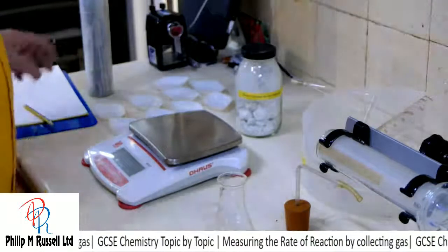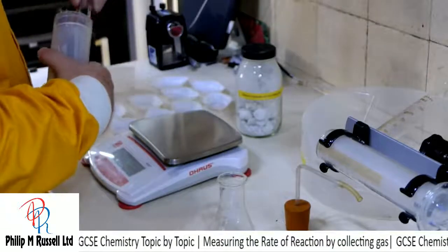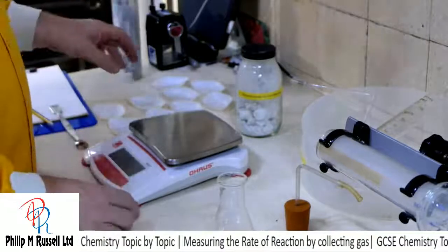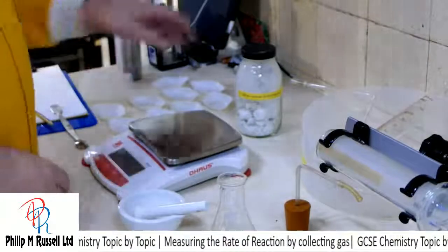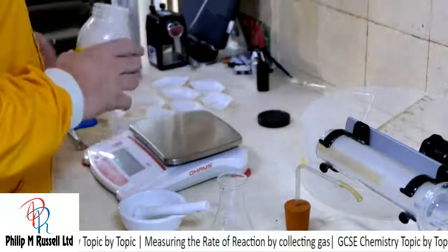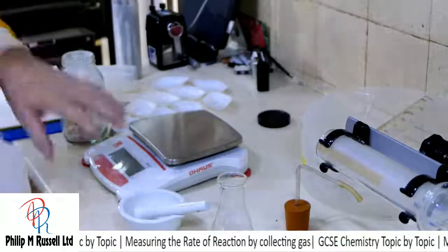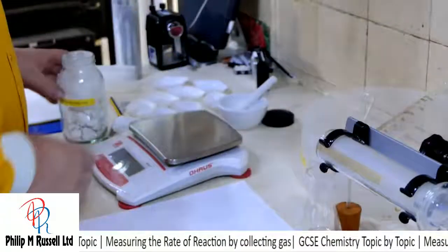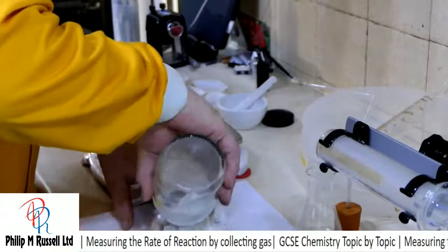This time I think we'll try hydrochloric acid, and we'll see if we can make that work a little bit better. So where am I going to start? Well, we're going to get out some calcium carbonate, and I've got my mortar and pestle, and we're going to try and get out some of this. So let's take some out. I'm going to put this on a piece of paper, then I can put it back nicely. So let's just get a few bits of this out.